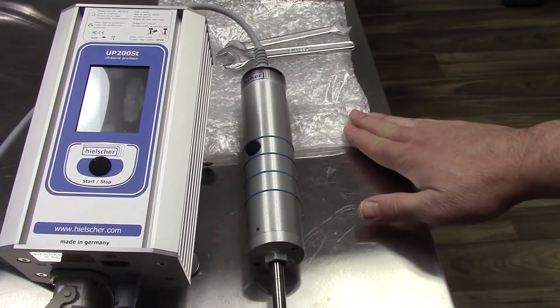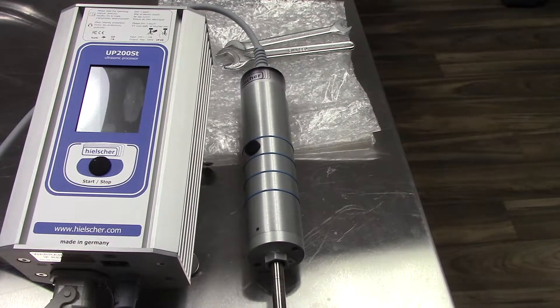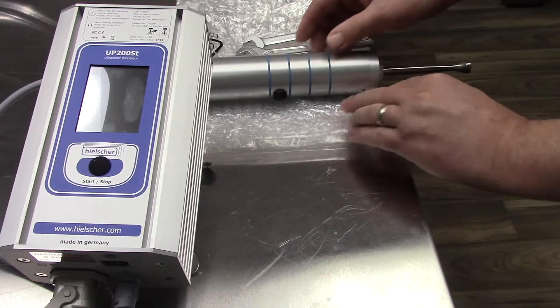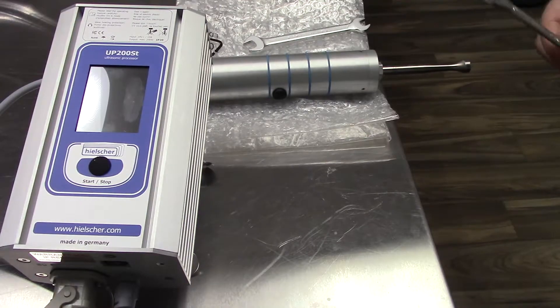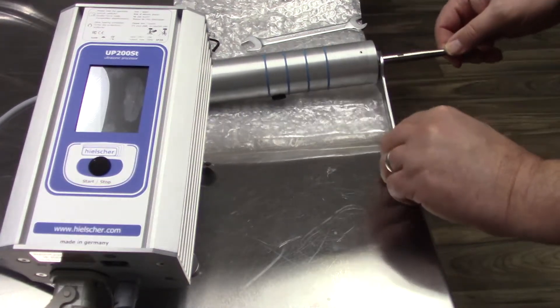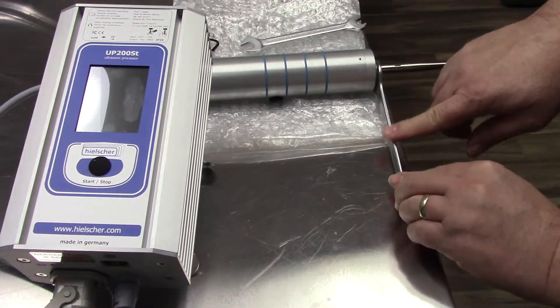Using a soft cushioned surface, position the instrument on the edge of a table, using the first wrench and the edge of the table to stabilize it.